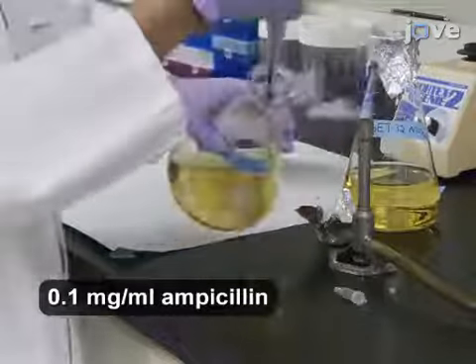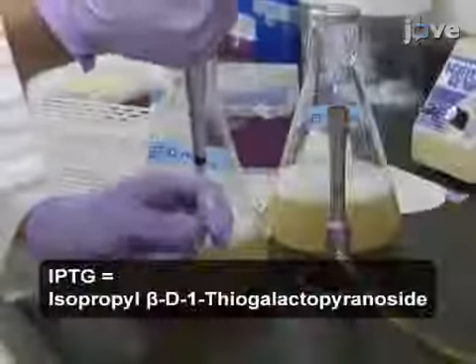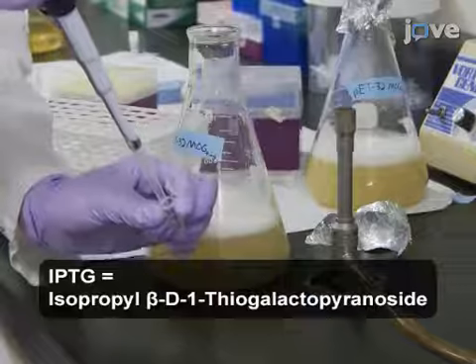Incubate at 37 degrees Celsius and 200 RPM for 5 hours, or up to an optical density of 0.6. Once the desired cell density is reached, add 0.5 milliliters of 1 molar IPTG to each culture flask.